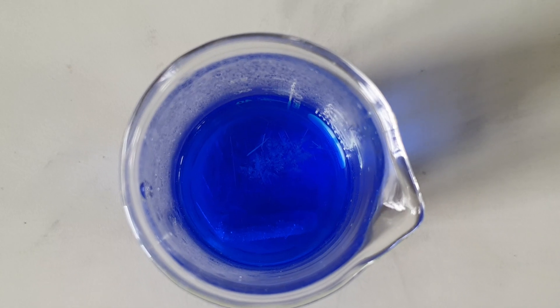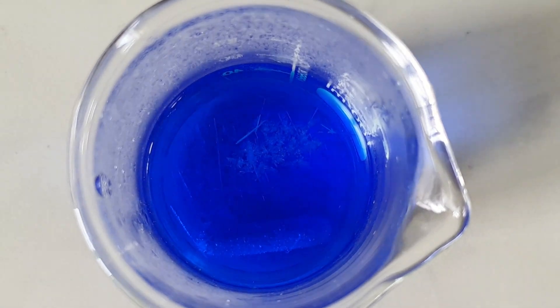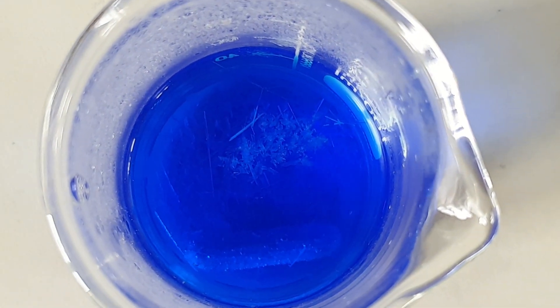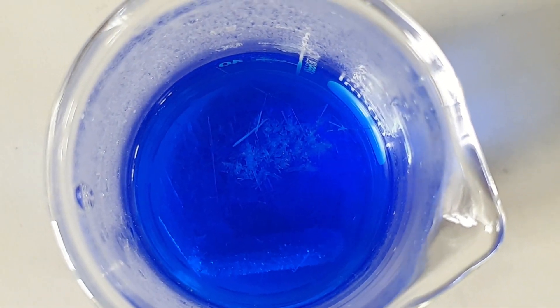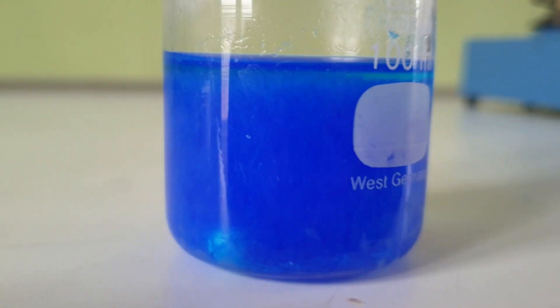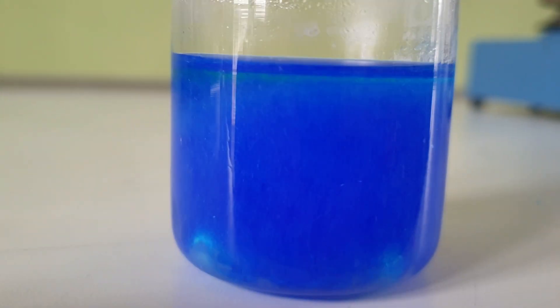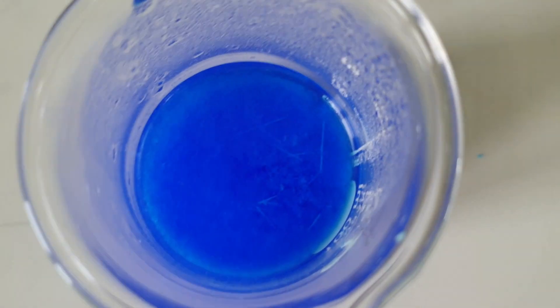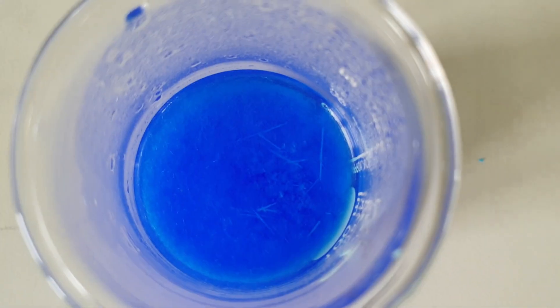Potassium bisoxalato cuprate is pretty soluble in hot water but crystallizes on cooling, forming long needles. Initially crystallization is slow, but suddenly a large amount of tiny crystals crashes out as a big block.